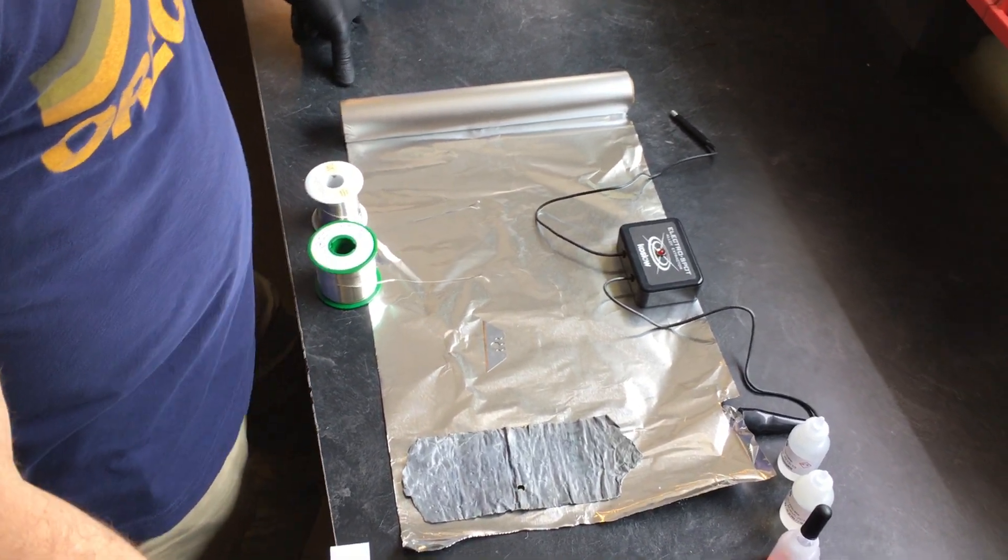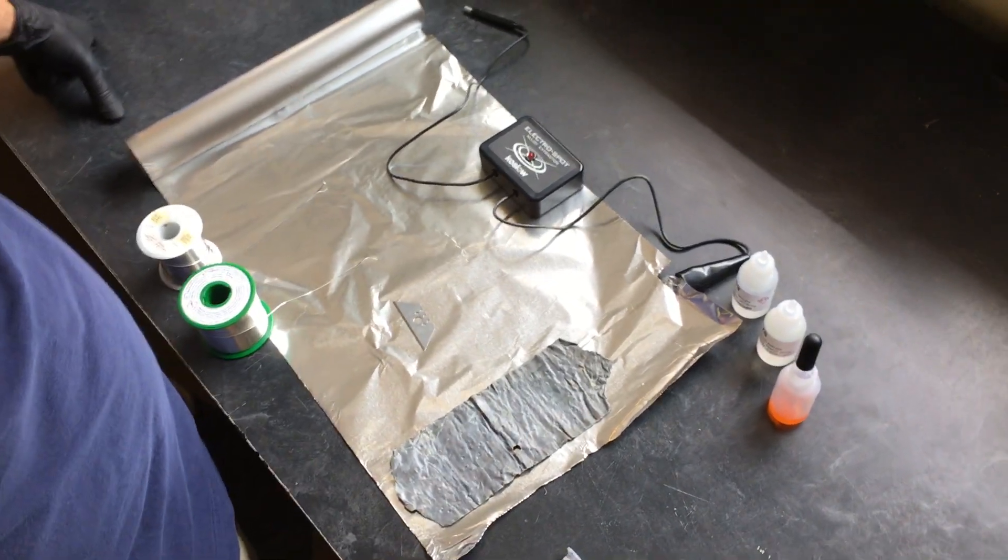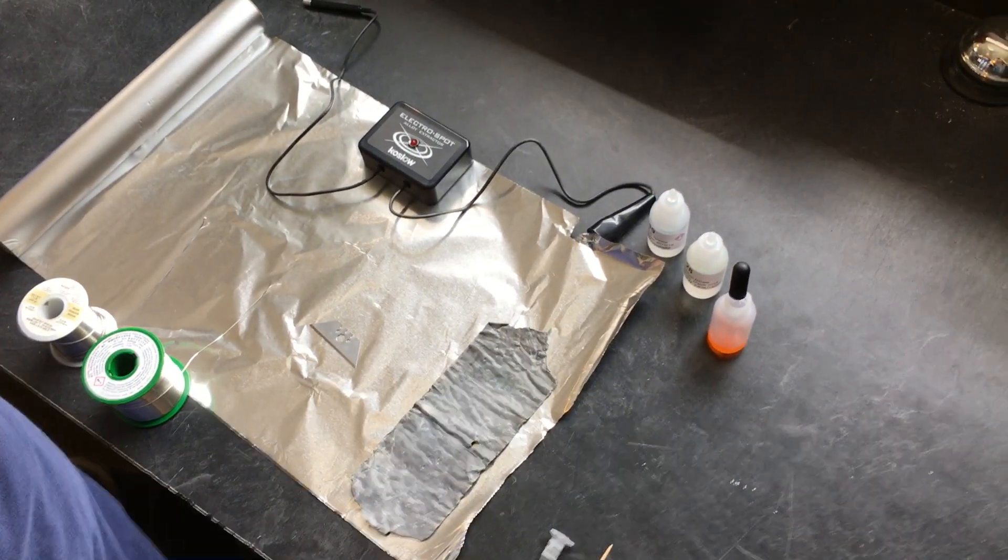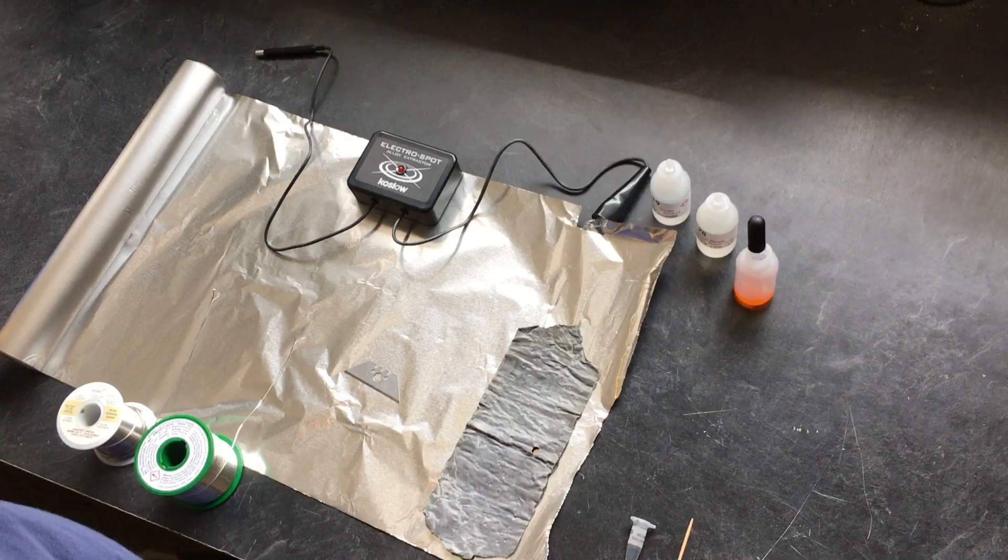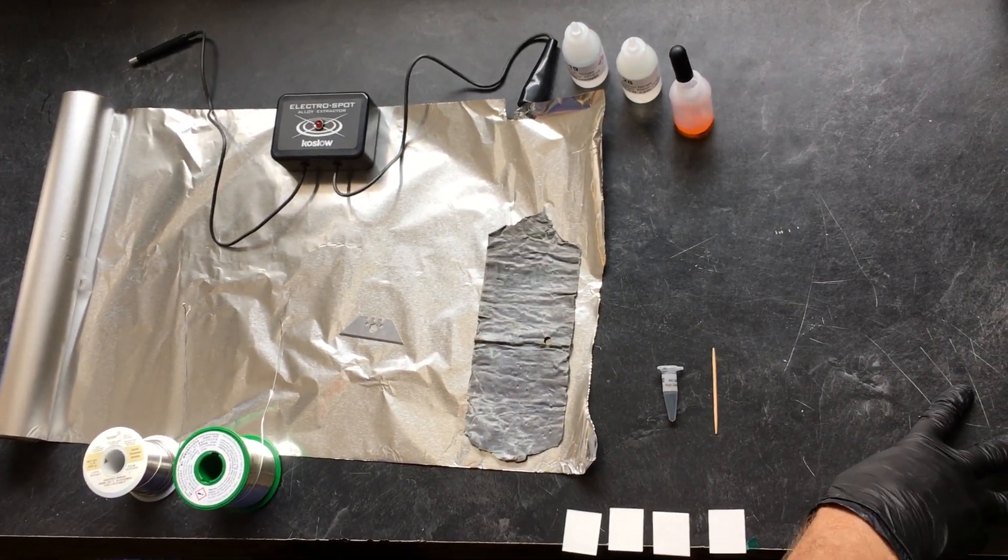Today I'm demonstrating the lead in solder test kit. I did this test once before and it was on YouTube, but the results were not really very clear to some people, especially if you wait a few minutes the results sometimes get a little bit better.